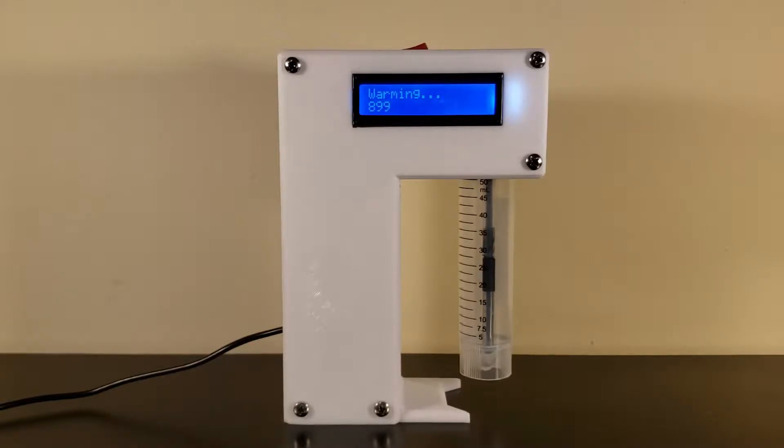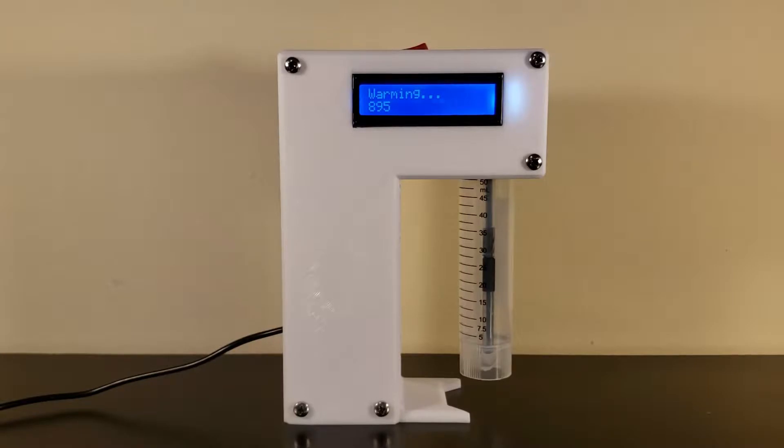The new software monitors this with a countdown timer. Be sure that a clean and empty sample tube is screwed in during the warm-up process.